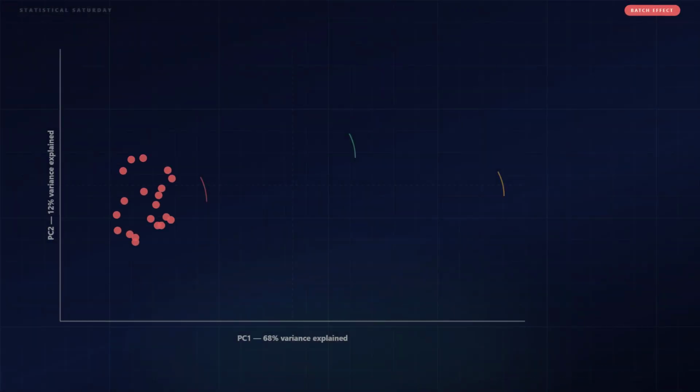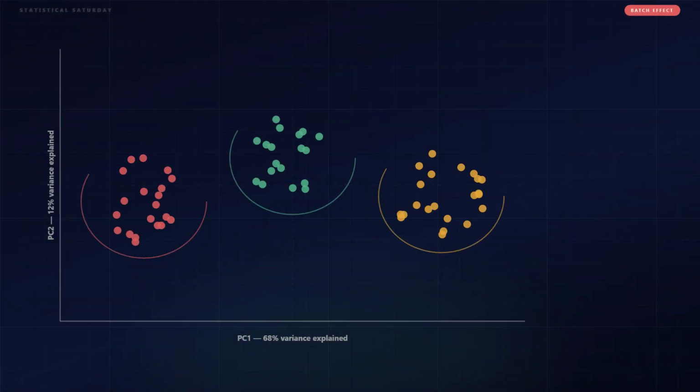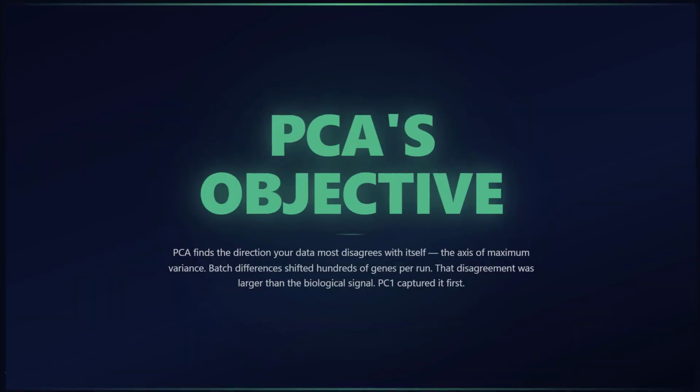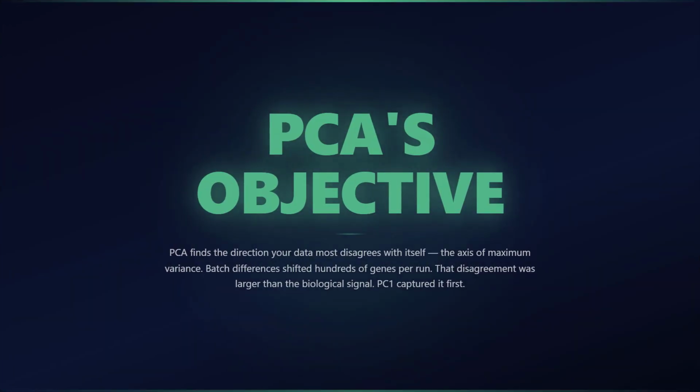Wait, the PCA found the batch effects and not the biology. How does it even do that? What is it actually looking for? It finds the direction your data most disagrees with itself. 3 sequencing runs, each shifted a few hundred genes by library preparation. That disagreement is larger than the biological signal.